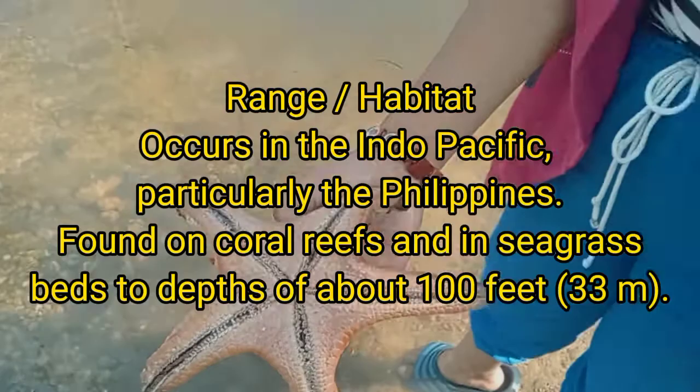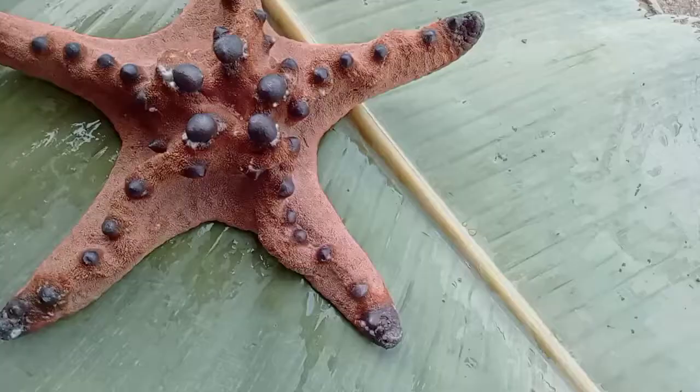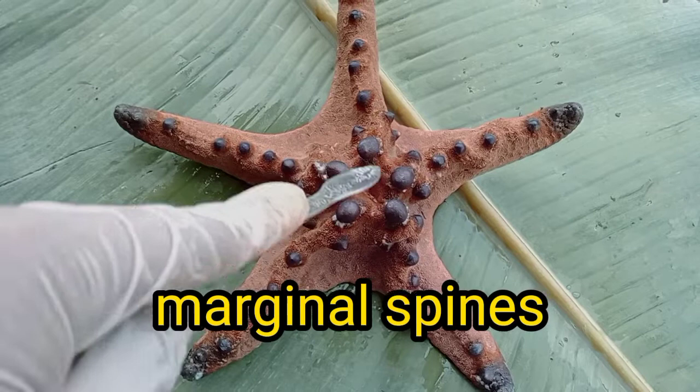For now, I'm going to identify the external parts of a starfish. Five arms — here are the five arms. This is the marginal spines. The central disc.